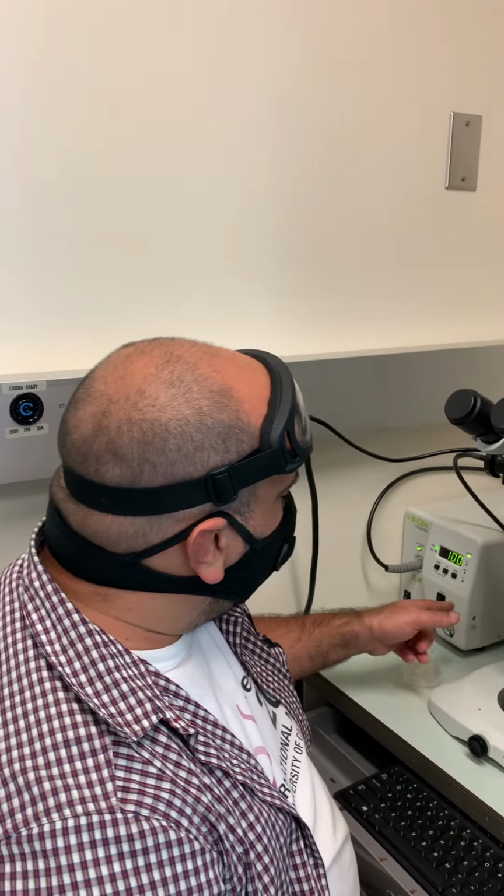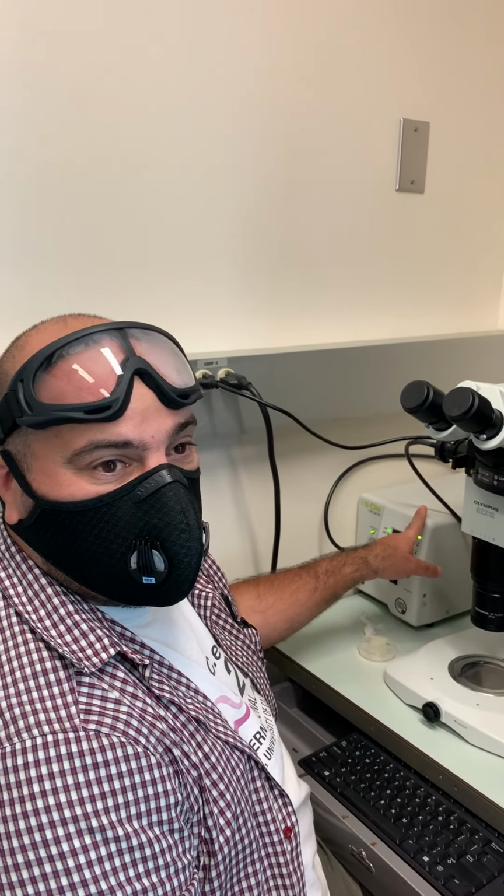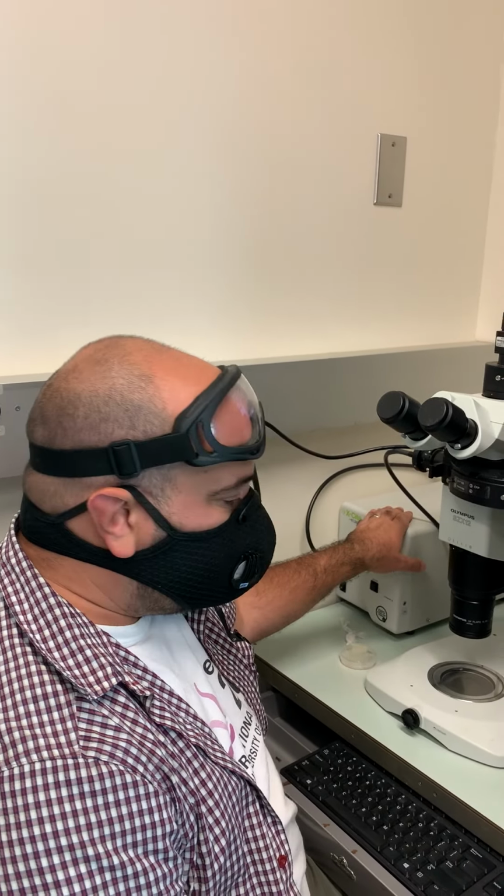Once you're done, make sure that you let somebody know so they can turn off the machine, the light source at the end of the day.